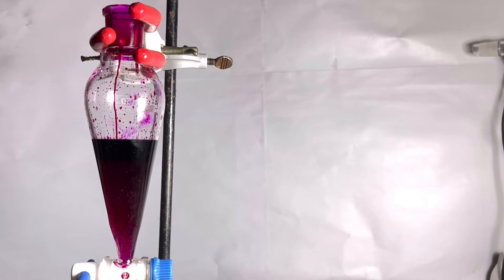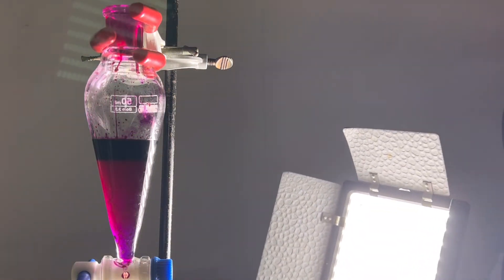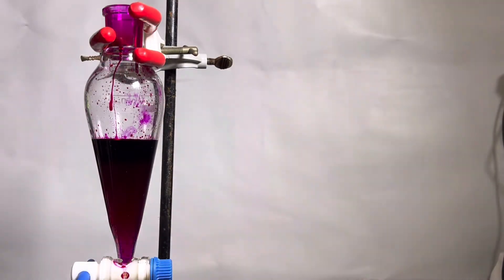Due to the high concentration of phenolphthalein, the solution appears almost black. The layers are also difficult to make out but they are there. I'll shine a light from the side so that you can see the two layers clearly.